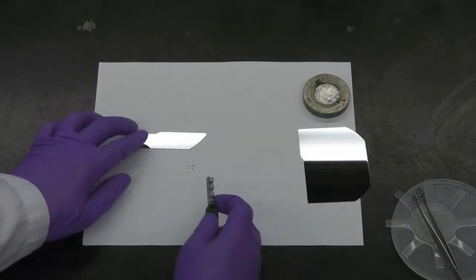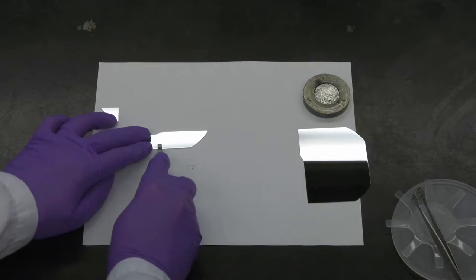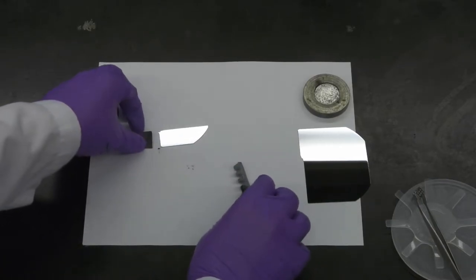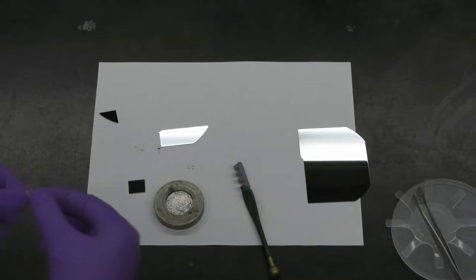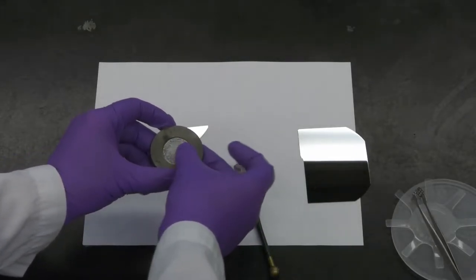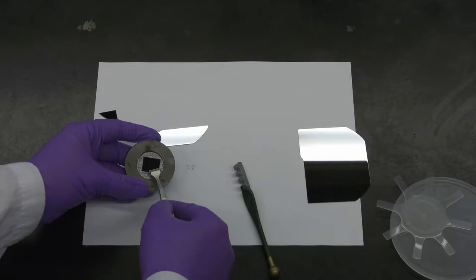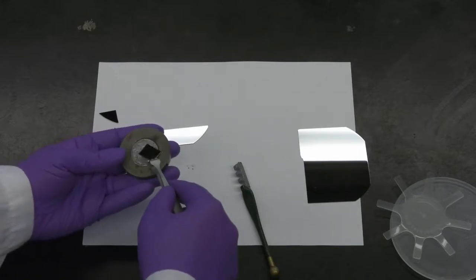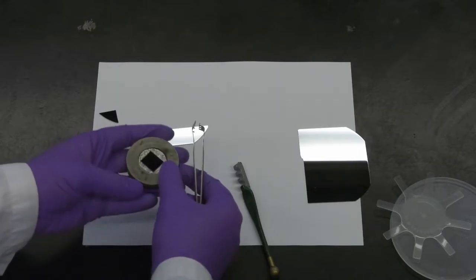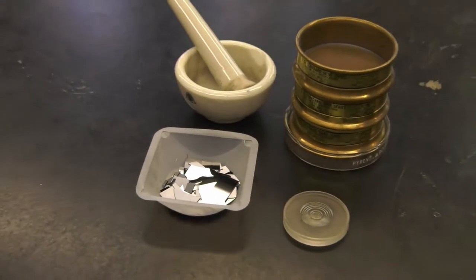The sample is further reduced in size to fit the XRD sample holder. The silicon sample is adhered onto the sample holder using double-sided tape. The remaining silicon is broken into smaller pieces which will be used to make powder samples of different sizes.